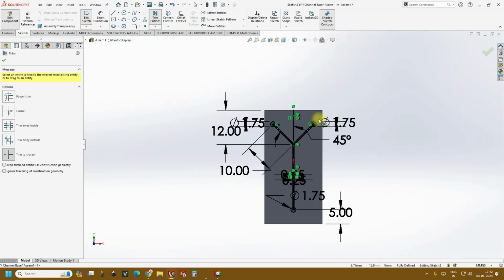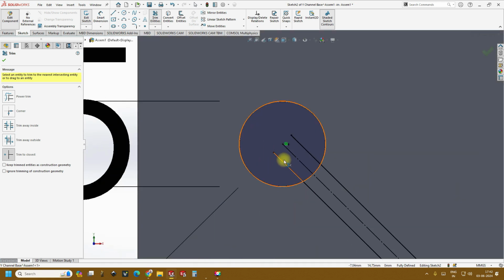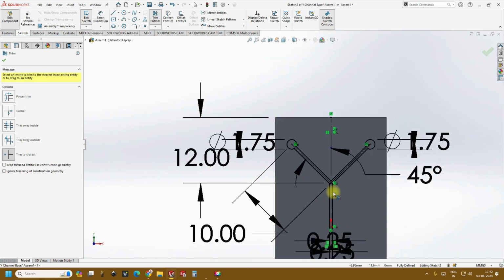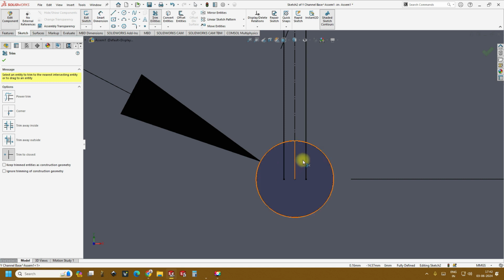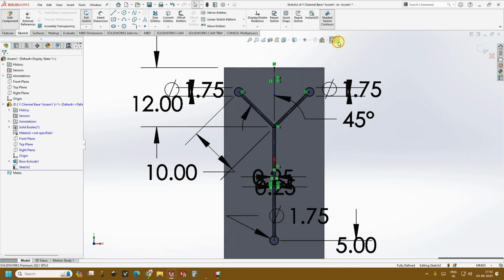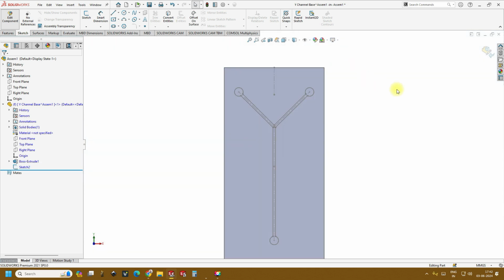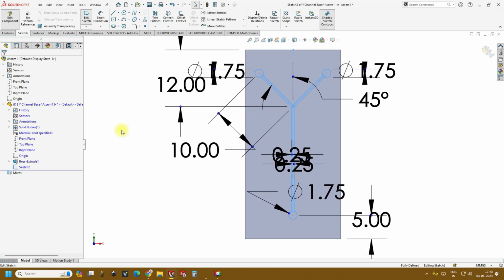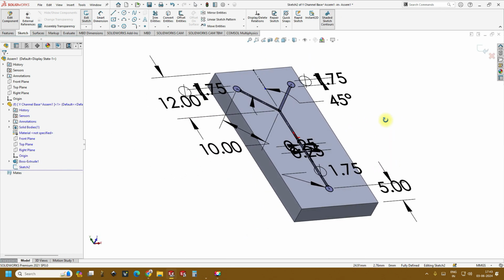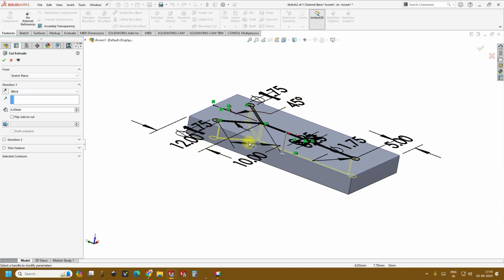And same here, and same with this. So now if you see, this shows the closed microfluidic chip. Okay. So this is how it looks like. Right. And now go to features back and cut extrude. So if you see, it is facing downwards and will give a depth of 1 mm.